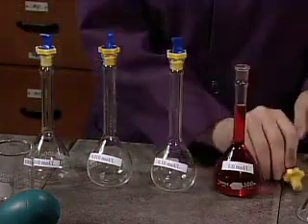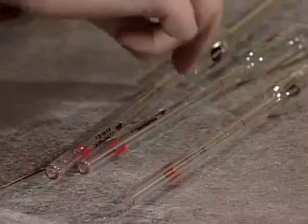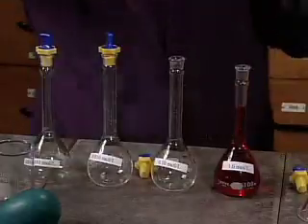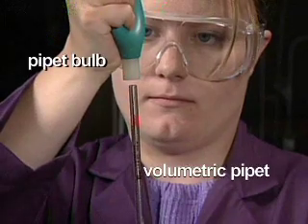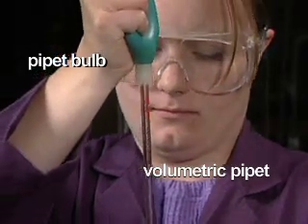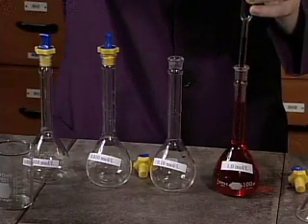The serial dilution begins by extracting 10 milliliters of the original solution using a 10.0 milliliter volumetric pipette and a bulb. Pay special attention to the technique required to use the bulb and pipette.